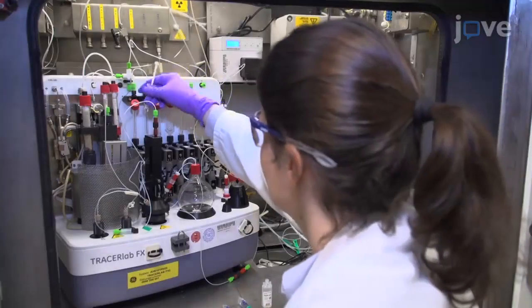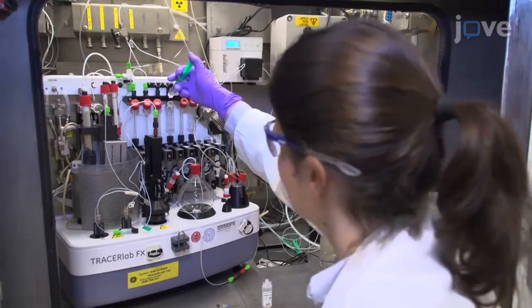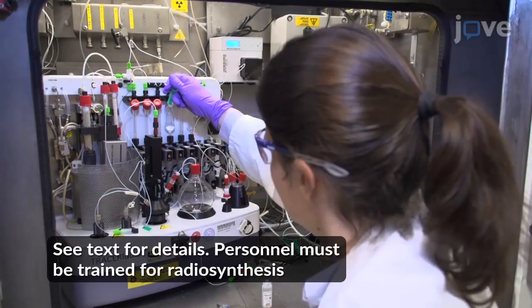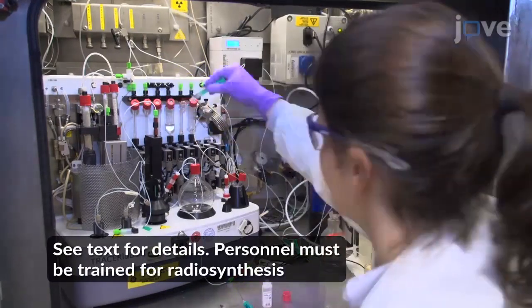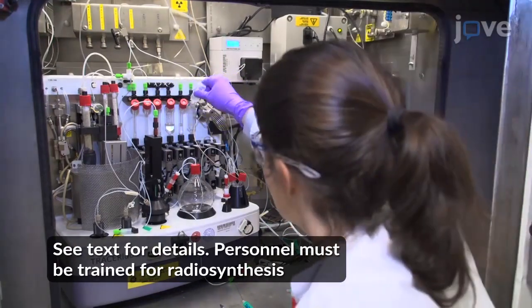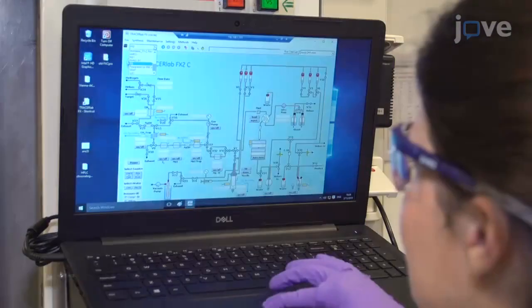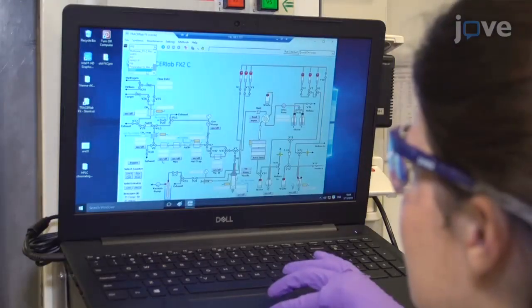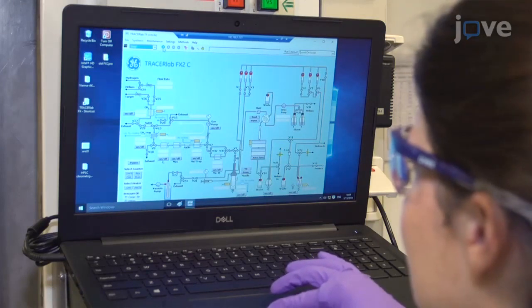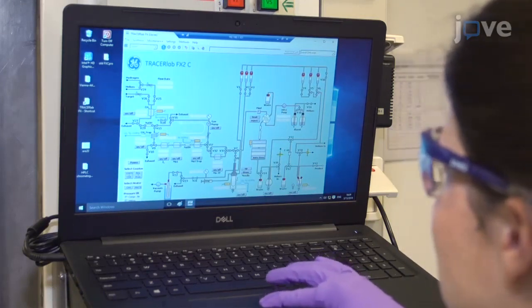To begin carbon-11 SNAP synthesis, set up a clean carbon-11 automated synthesis module with the appropriate reagents and materials. Start the SNAP synthesis process on the module computer, which will begin with system checks and conditioning.